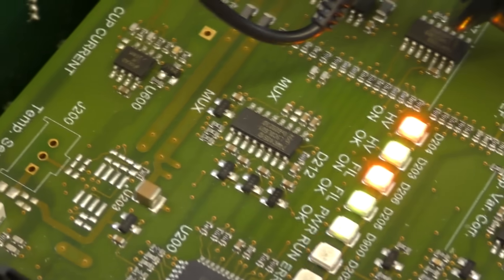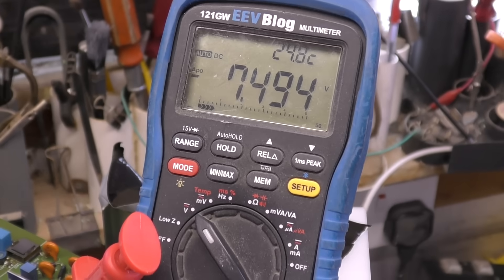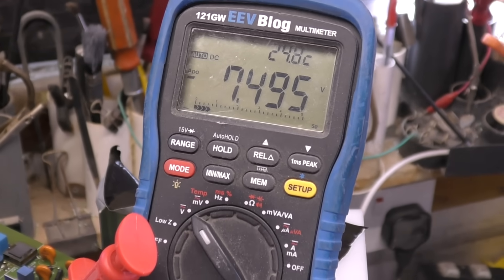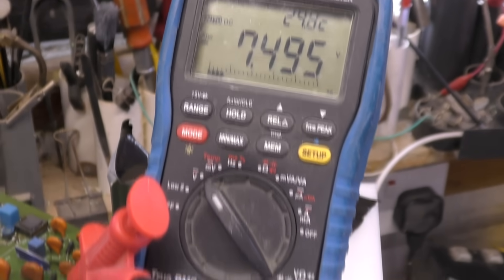Interestingly, we do have a filament OK LED. I've pulled up this meter to measure the voltage. Obviously this is raised to about 5kV, so I'll put the meter on this big block of plastic. We've got about 7.5 volts across the filament.